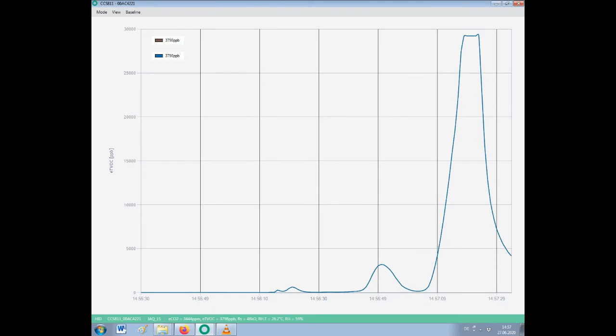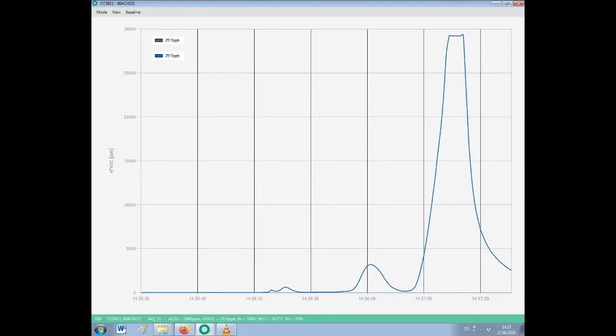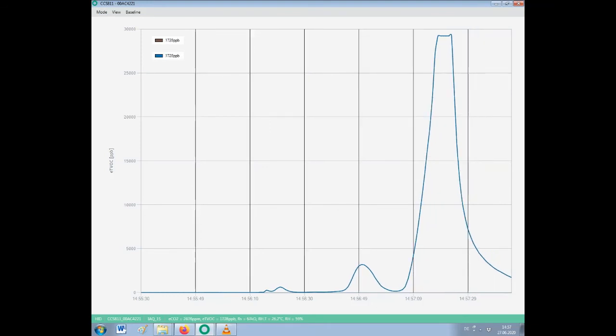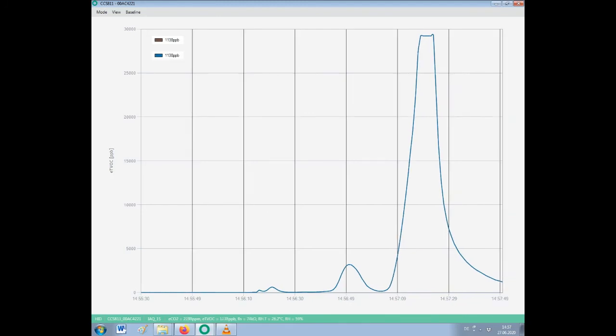The reason is the polar column: the polarized compound, in this case the ethanol, remains the longest time in the column. So I think not just the biggest and highest peak, but also the latest peak has to be the ethanol.